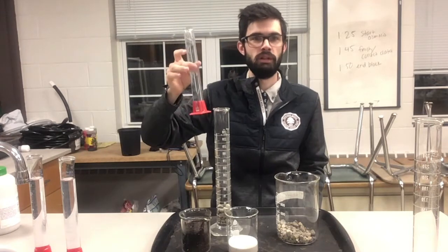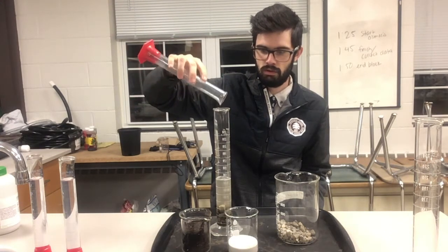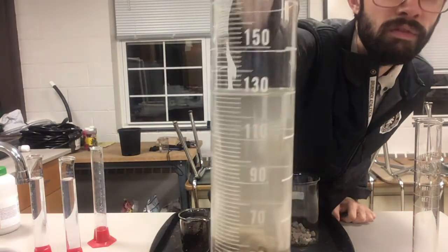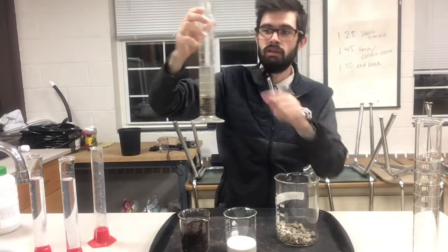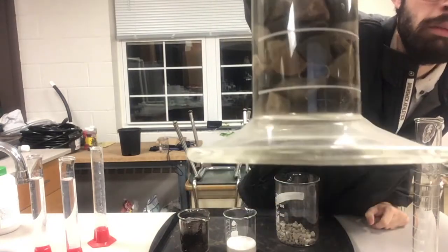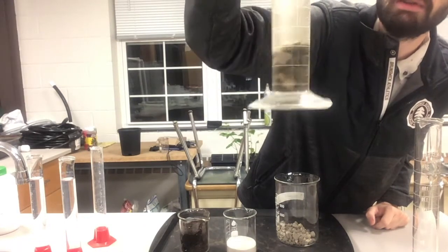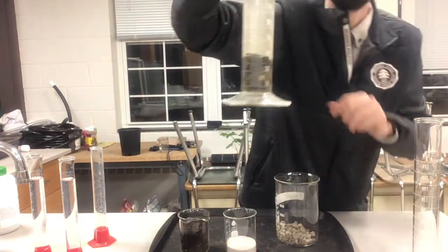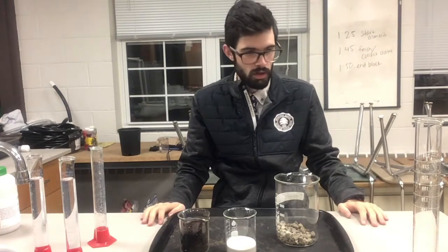So now I'm going to take my 100 milliliters of water and dump that in with the rocks. Take a look at what we've got — go ahead and record that measurement. As you can see, there's a difference. In theory it should be up to 150 milliliters, but there's pore space. You can actually see there's a little bubble there. If I shake it up, that bubble's going to pop and get filled with water. Water is filling up the pore space, so it's actually going to be less than the total volume because there's air pockets in between each particle.